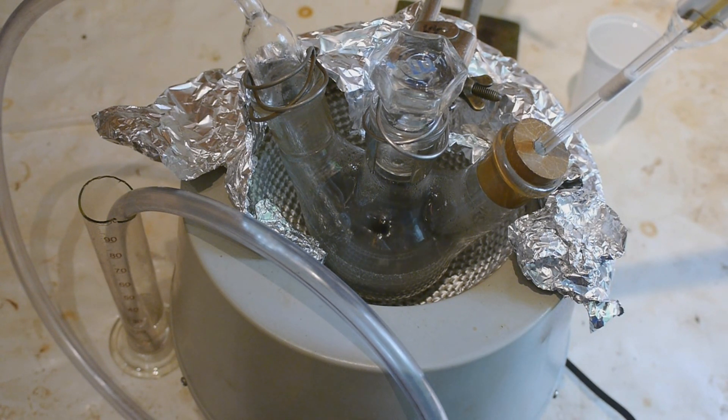After about one hour the evolution of hydrogen is so slow. So we know that we are getting a bubble less than every 10 seconds. So according to the instructions from NerdRage we now should be able to turn up the temperature to 200 degrees Celsius inside the reaction vessel, and that should start the production of sodium metal.